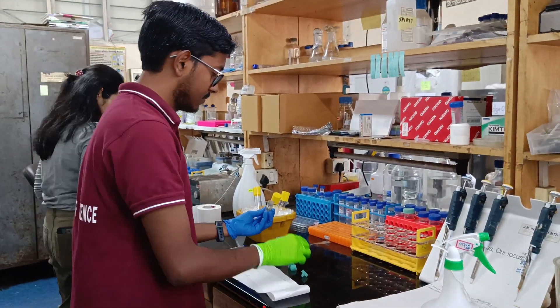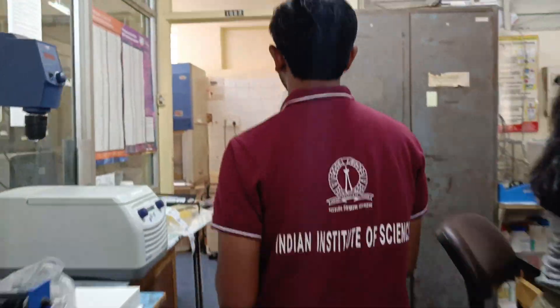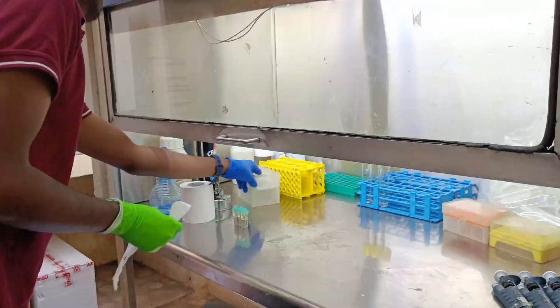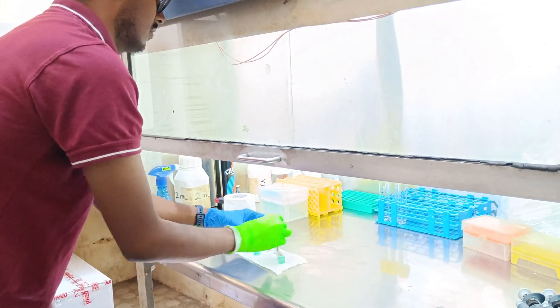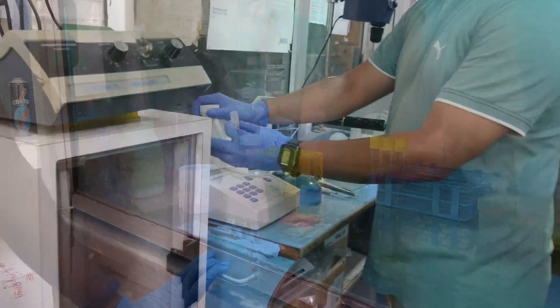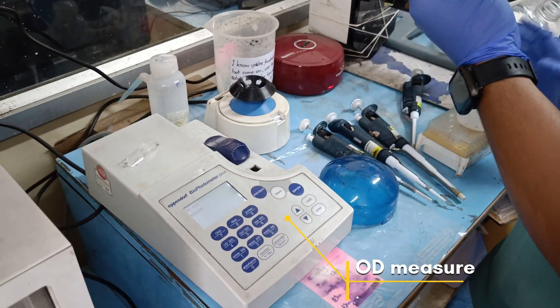First I am cleaning the cuvettes with 70% alcohol and then I will put them in UV ultraviolet sterilization. Next we need to check the optical density (OD) of the bacterial culture which we are going to use to make the competent cells. We gave the inoculum for this culture yesterday.